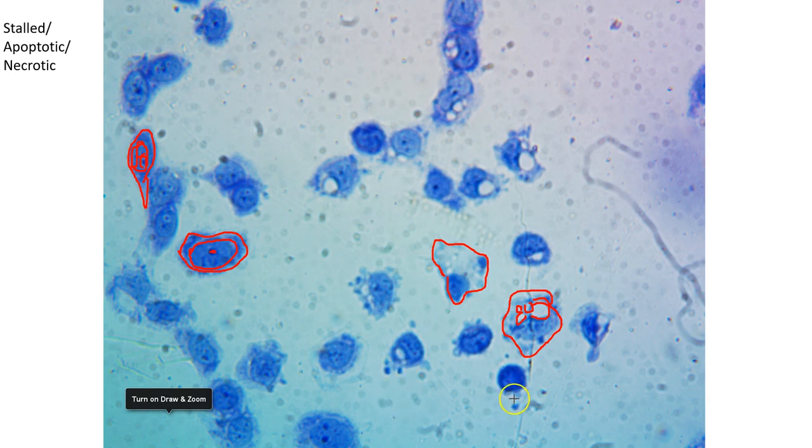Other cells in here, like here, which has a lot of blebbing and is round, are more undergoing apoptosis. This one could be undergoing apoptosis or necrosis. It's a little bit in between, but clearly a lot of these have the typical features of necrotic cells. So these large holes or vacuoles, along with pixelation in the cell membrane itself.